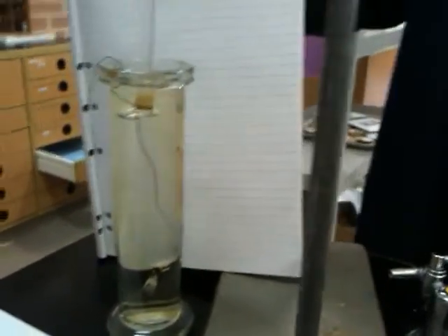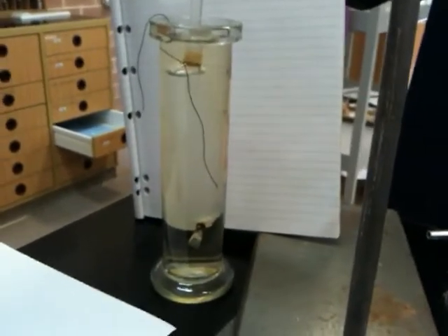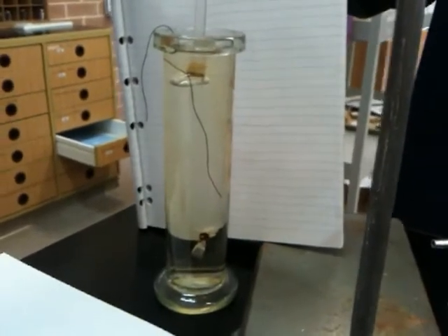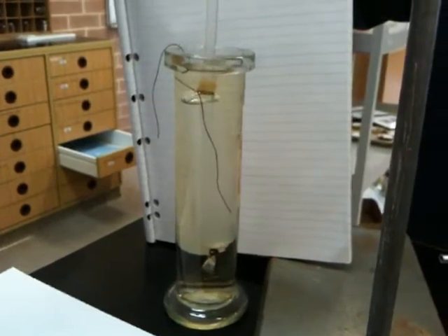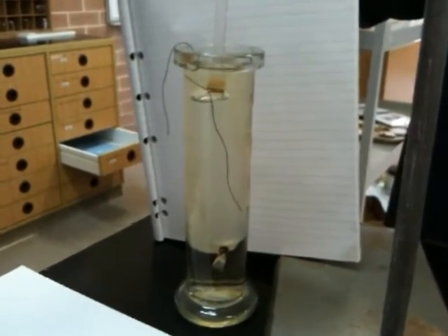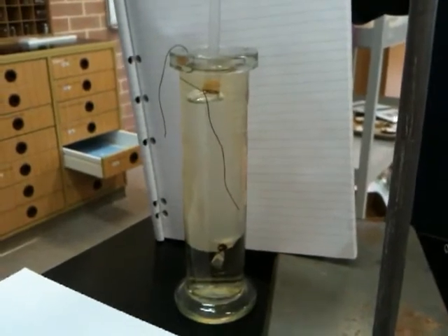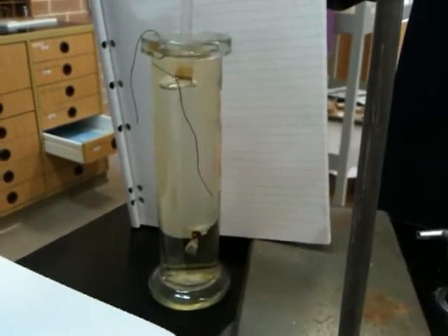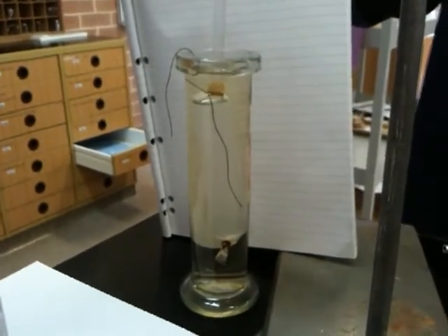Okay, so we're here with Group 1 at school, in biology class, and we're studying cell membranes and the difference between diffusion and osmosis. So currently we've set up what sort of system? So what have we set up? A system to test osmosis. Yep. The purpose is to observe and compare examples of diffusion and osmosis.